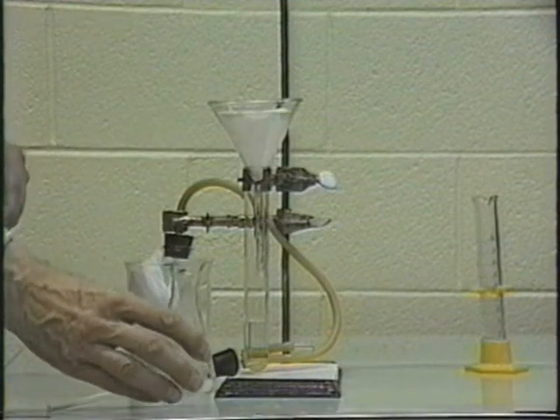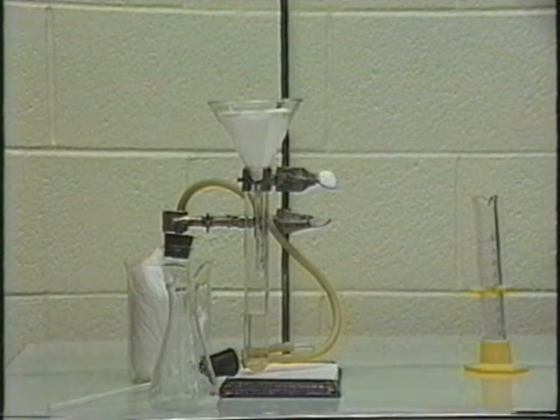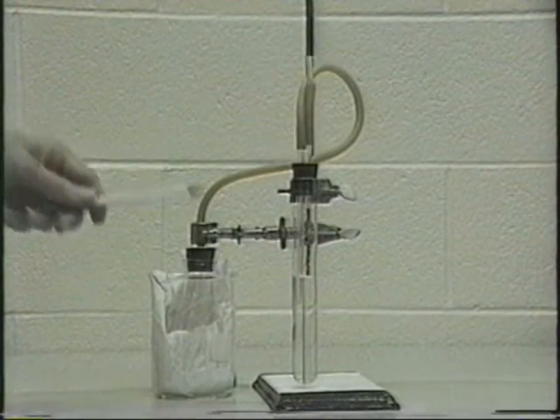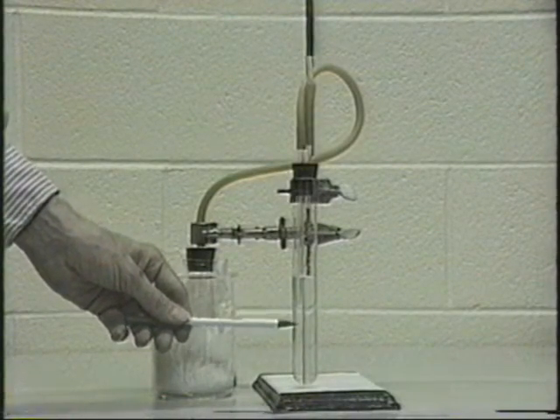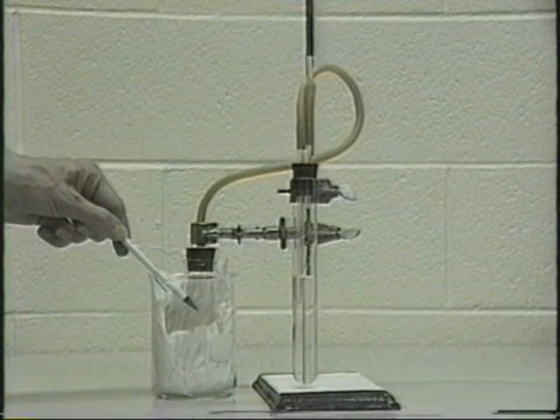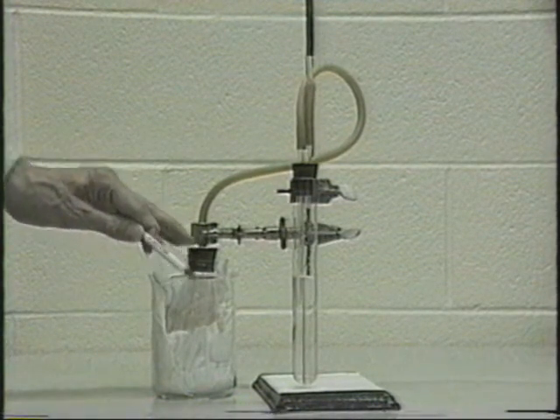And that's it. That's going to be the filter paper funneling. Now this is the reaction setup then. We have here a solution of salt and ammonia. We will put in this flask dry ice and stopper it tightly.